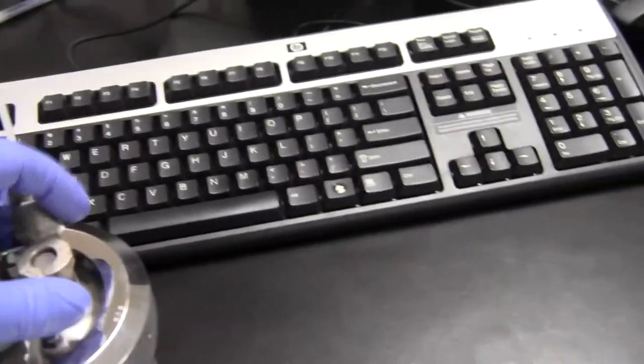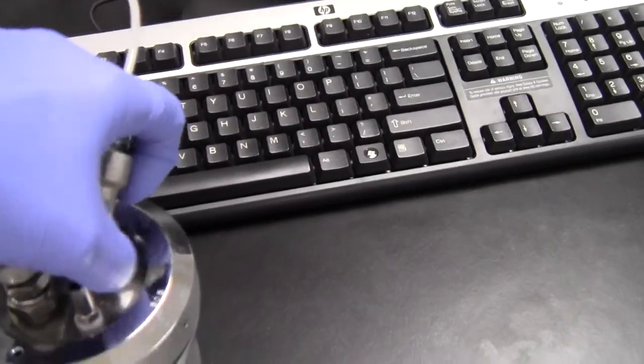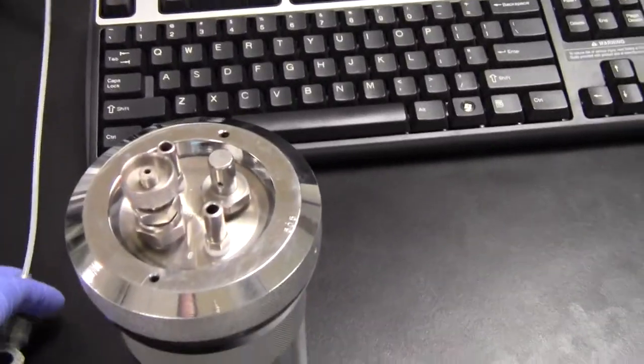When that's full, it'll clear the line. It'll make a little noise to clear the line so that we can actually pop that off the top.